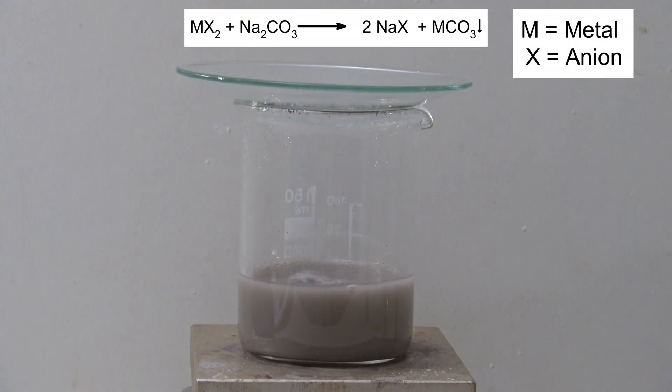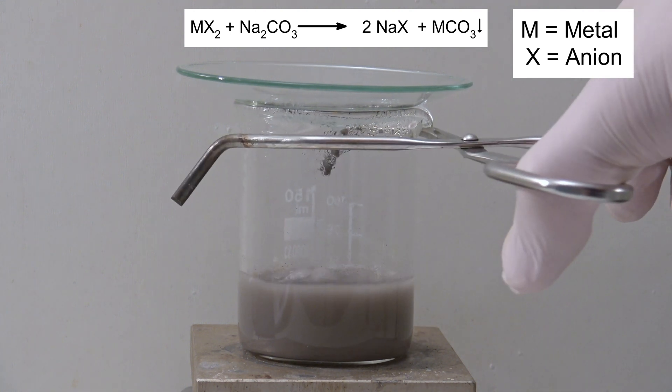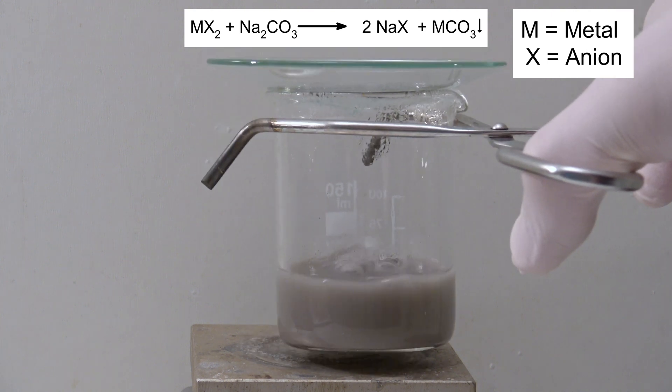Here the ions of the salts are separated, leading to the formation of insoluble carbonates of the metal ions, while the anions stay in solution as the sodium salts.